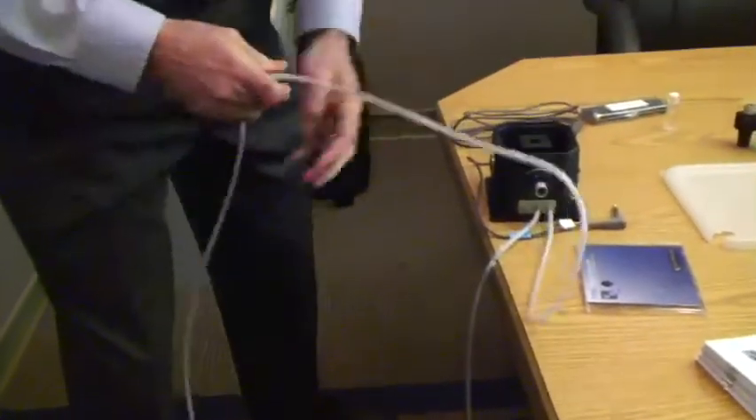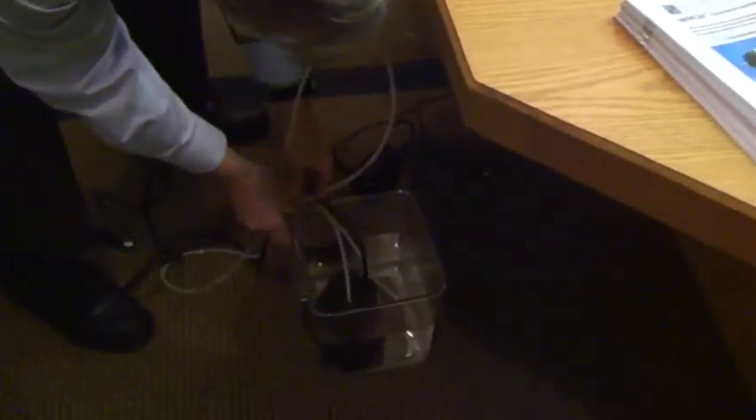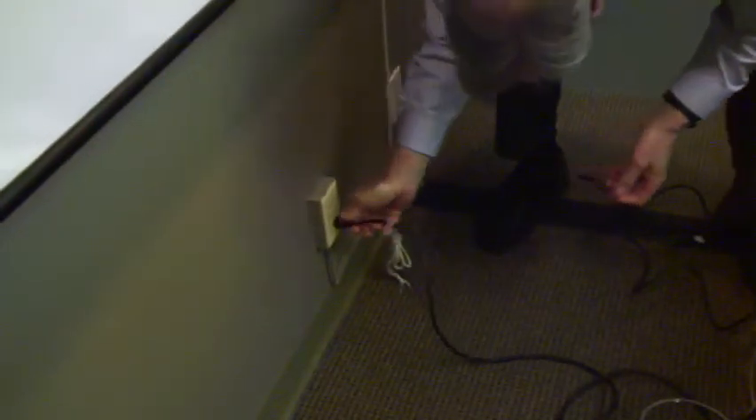To make that happen, I'm going to take the water from the pump and put it in here. I'm going to take the water out of here and put it back in the bucket. There's a cover that goes in the bucket, and you turn on the pump by plugging it in.